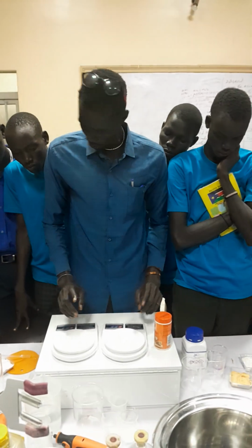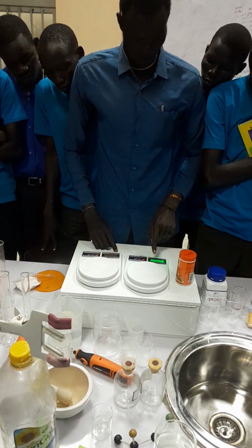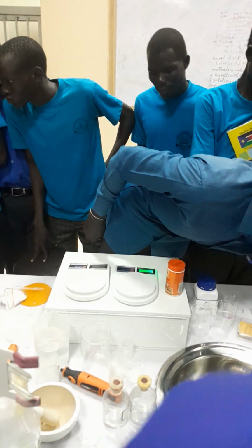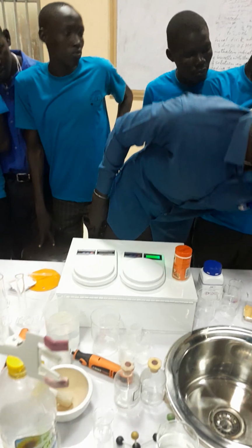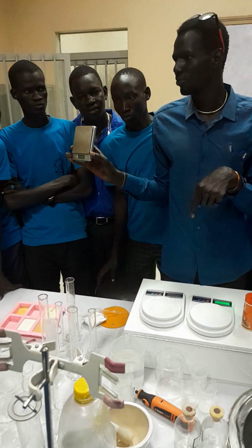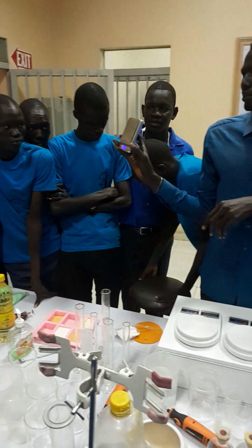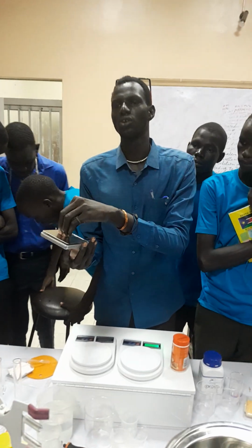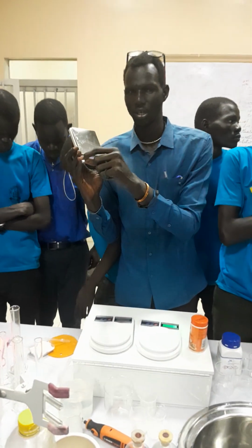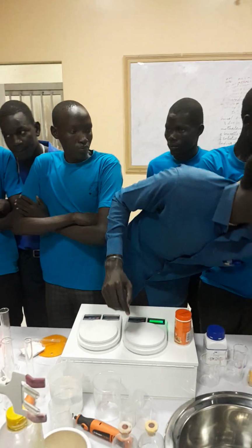And then now you can open it. When you open it like this, this one is working. Even this one. Those, I think the battery is low. That one is working. Even this one is a different design, but of the same electronic weighing scale. If you want to weigh anything, you put it on top of this, then it will give you the reading, the mass. So these are the weighing scales.